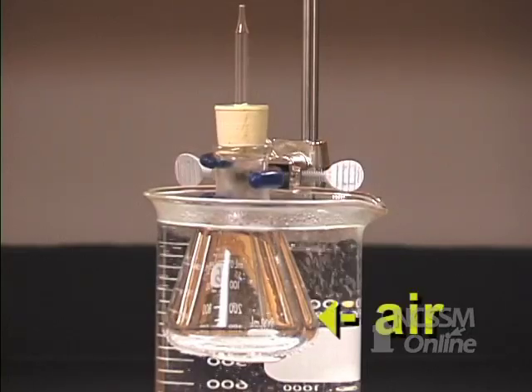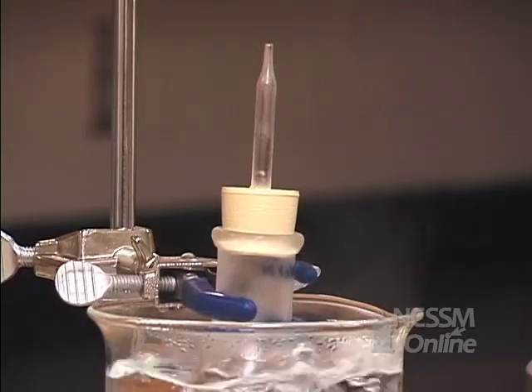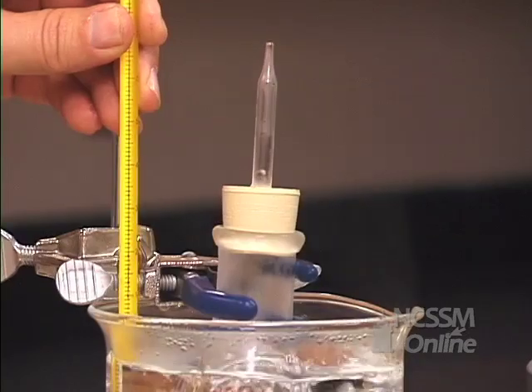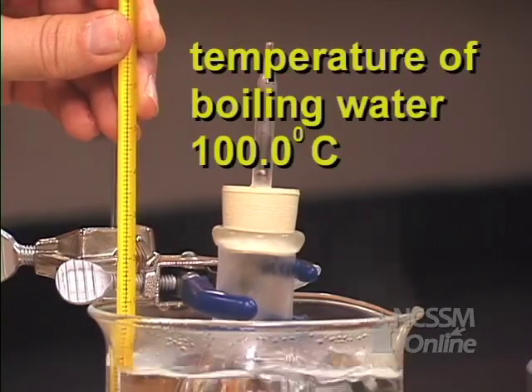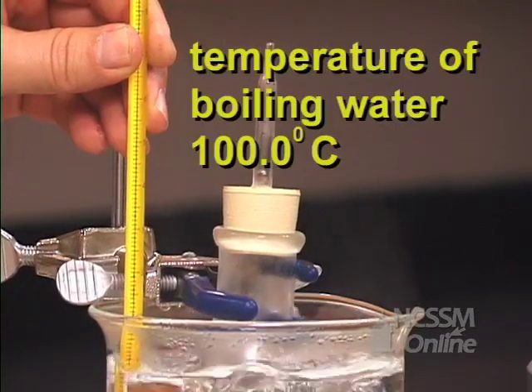The gas inside the flask, which is air, will expand as it's heated. When the air inside the flask comes up to the same temperature as the boiling water bath, there will be just enough air in the flask to fill the flask at the boiling point of water.